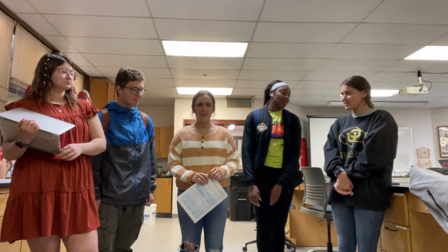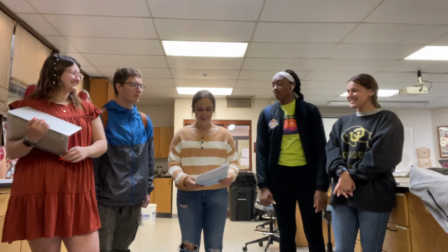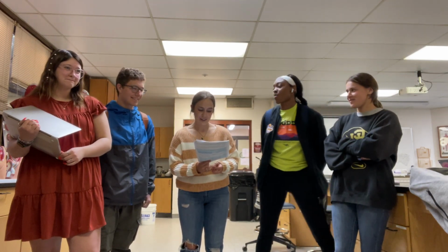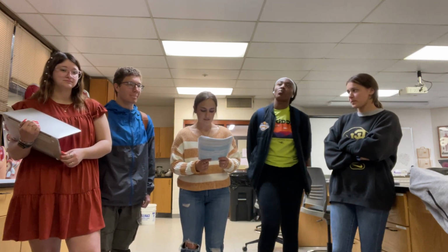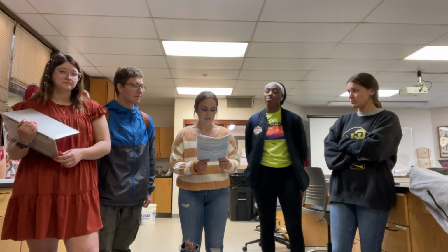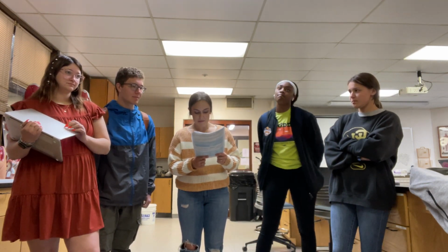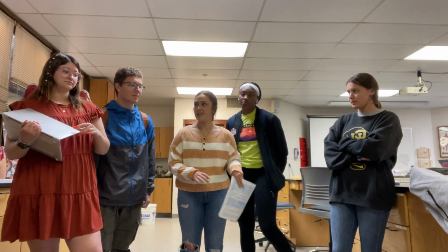For the locomotion of the perch, they move through the water by swimming. They use their muscular contraction to generate flexion along their body to generate force through their caudal fin. Additional movement of median and paired fins also aid movement of the perch. And movable fins like the dorsal, pectoral, pelvic, and anal fins aren't used for movement, but they control the orientation.